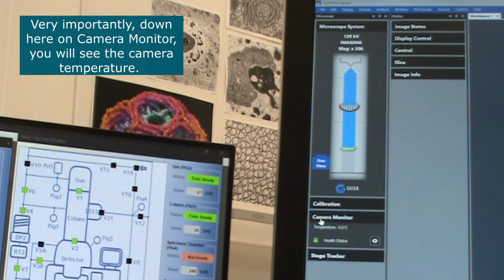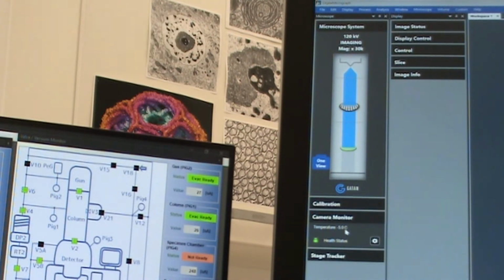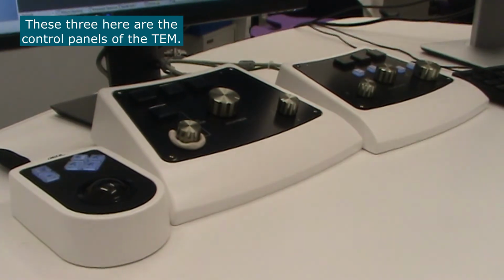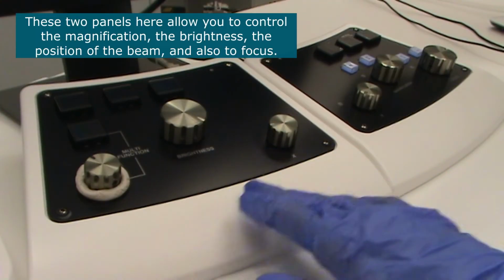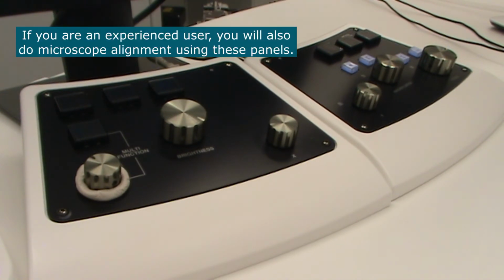Very importantly, down here on camera monitor, you will see the camera temperature. You should only use the camera if the temperature of the camera is at -5 degrees Celsius. These three here are the control panels of the TEM. The trackball allows you to move the sample in X and Y to look for a nice area to image. These two panels here allow you to control the magnification, the brightness, the position of the beam, and also to focus. If you're an experienced user, you will also do microscope alignment using these panels.